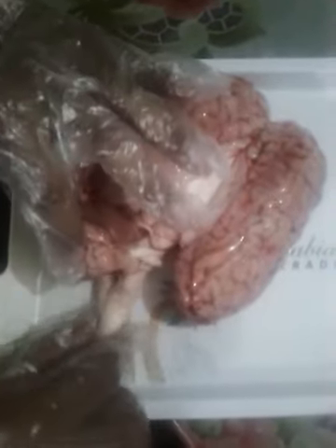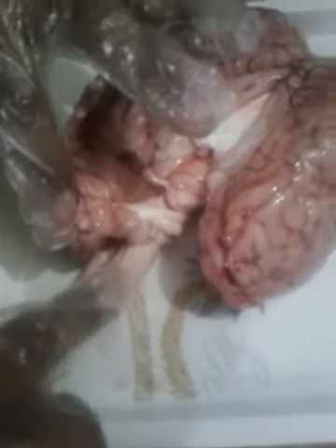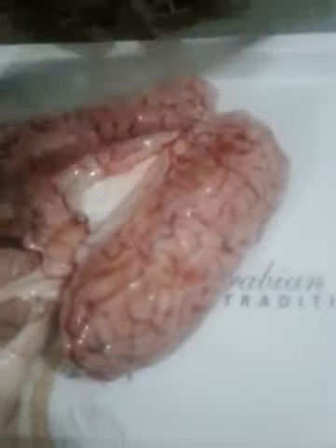This is the brain stem, and in this brain stem you will find this area which is known as pons, and this brain stem is finally connected with the spinal cord. It directly connects with the spinal cord, and the spinal cord is present here. If we cut the brain in the middle portion, or if we change the position of the brain, we can see the other side of the brain.